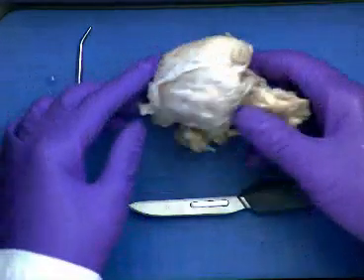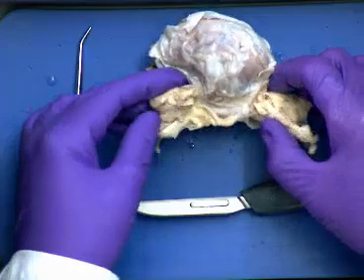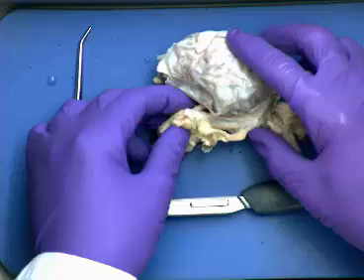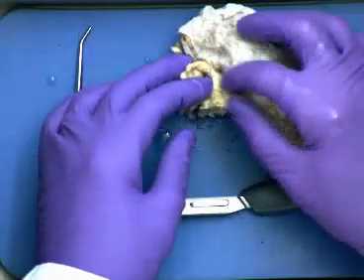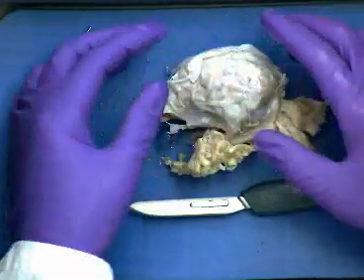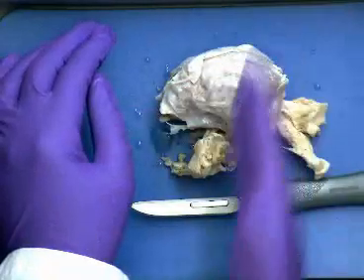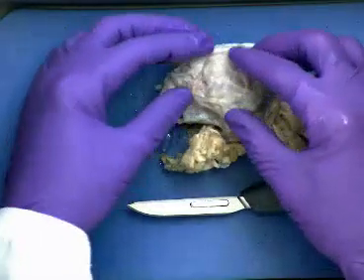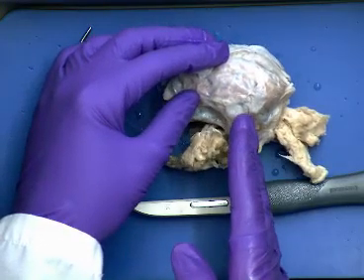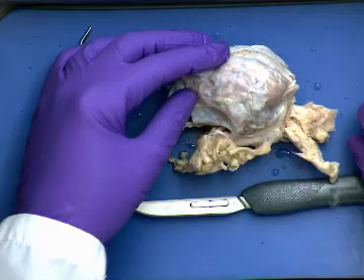So what we're seeing here is some additional structures that are associated with the brain. You can see some of this is adipose tissue, and we can also see even some cranial nerves that are passing through. There's going to be some blood vessels and things like that. Remember that the sheep itself is oriented horizontally, whereas we're going to be oriented vertically. So whereas our cerebrum is going to be up here, and then we saw the midbrain and the brainstem and the cerebellum kind of coming down like this at a right angle, for the sheep, it's going to be coming off like this instead. Okay?